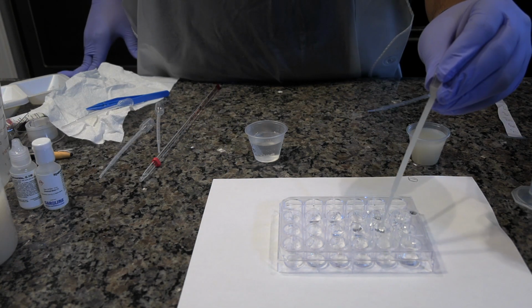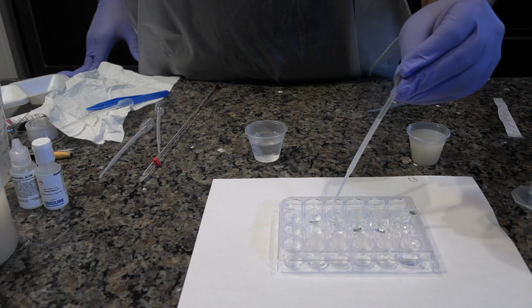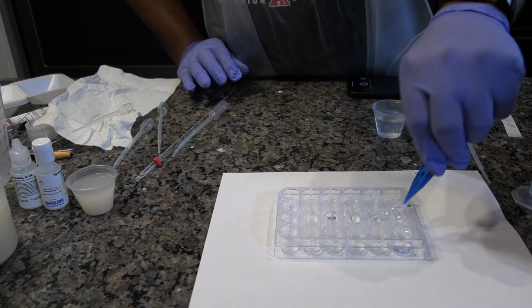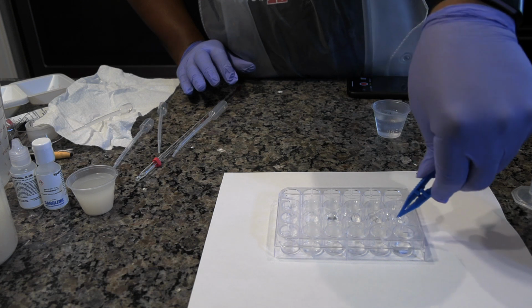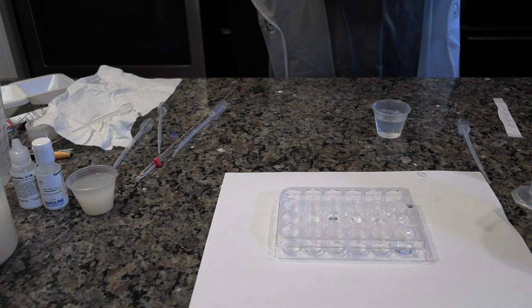Take the pipette labeled catalase and add 10 drops to each well in rows B and D. Swirl the well plate to mix the contents. With a pair of forceps, take a dry filter disc and dip it into well B1. Remove the disc and blot by dragging it across the top of the well on both sides.